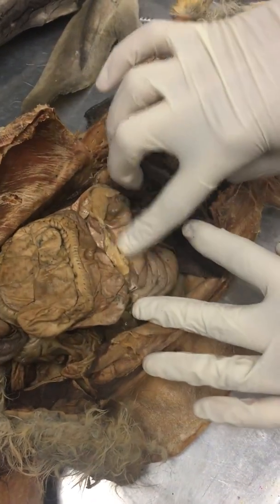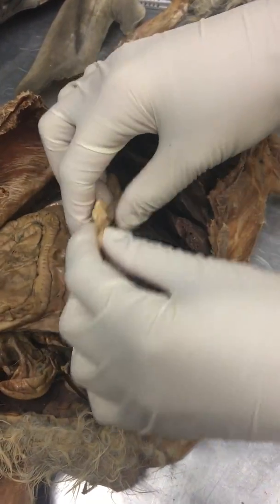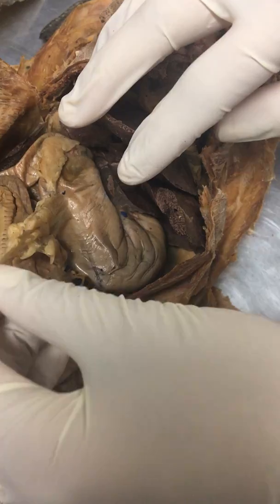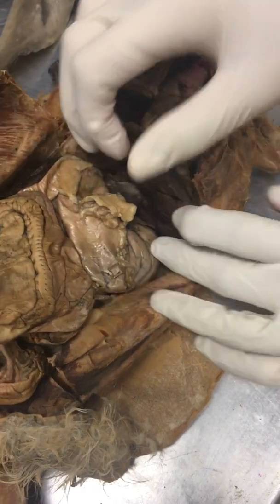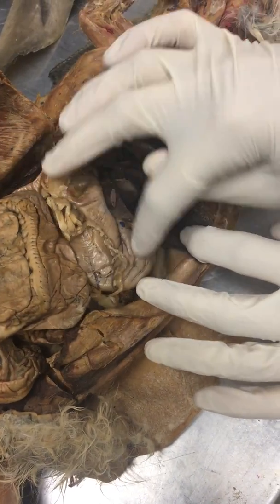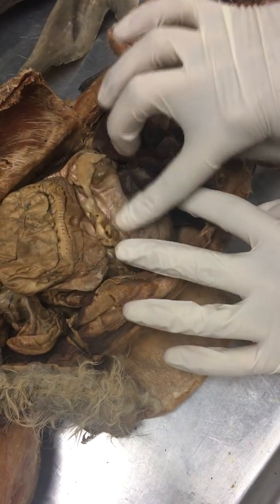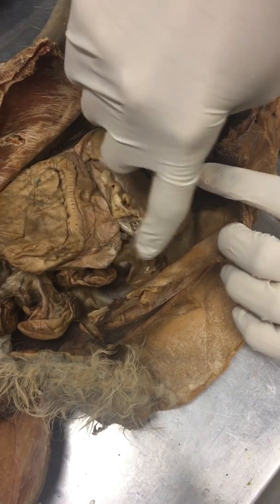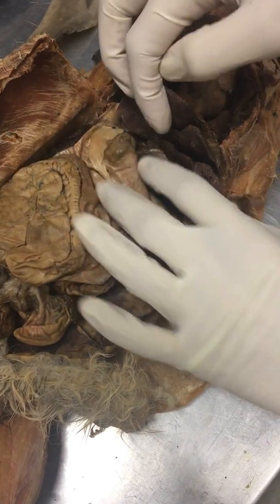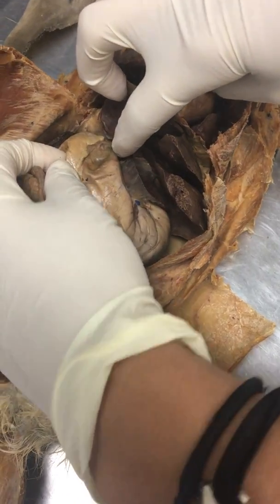And this is the stomach here, and this mesentery that's attached to the stomach here is the omental bursa, and I guess normally it covers all of the intestines and the stomach. So this is the stomach, and then the body is the main area of the stomach, and then you have the greater curvature on this end, and the lesser curvature, I believe, is on the smaller side.